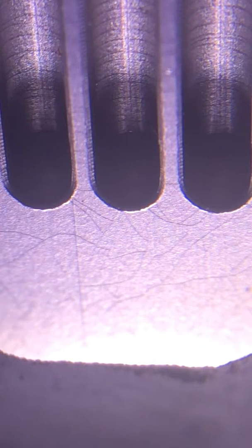If this had been a product of an experiment I probably would have started about 10 to 15 degrees below the melting point because you never know with the impurities how much the melting point's going to be below the actual melting point. But with a pure sample you can start pretty close.